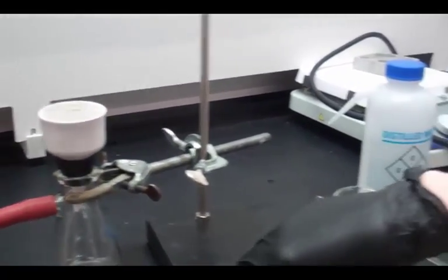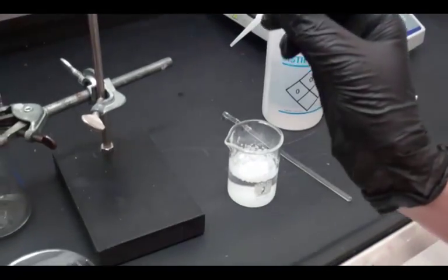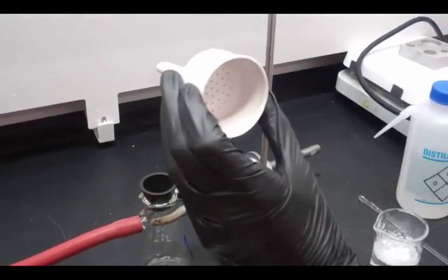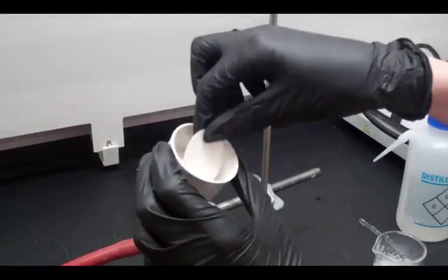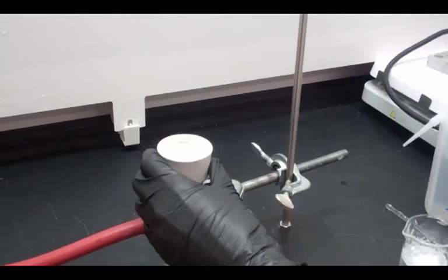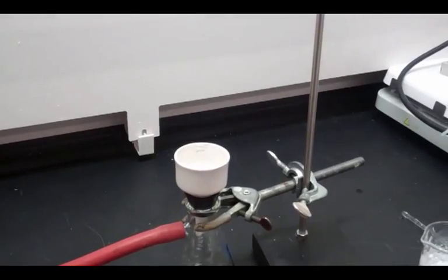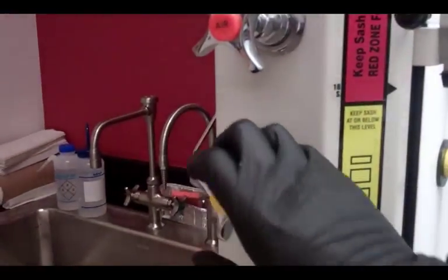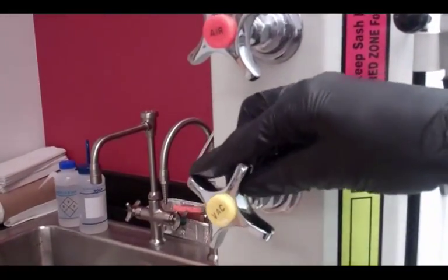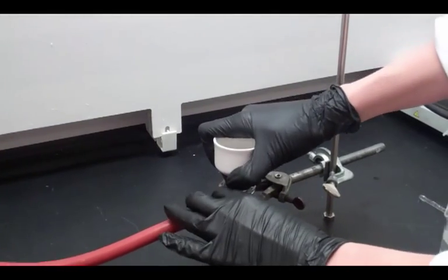So here's our mixture. The first thing we're going to do is put this filter paper in this funnel so that none of the solid will go through those holes there. So we're going to go ahead and put that in there. We're going to get it a little wet, just create the seal, and then we're going to turn on the vacuum. Now with that vacuum on, this should be firmly sealed down there so that I can't pull that up.